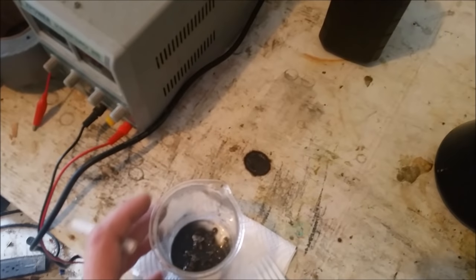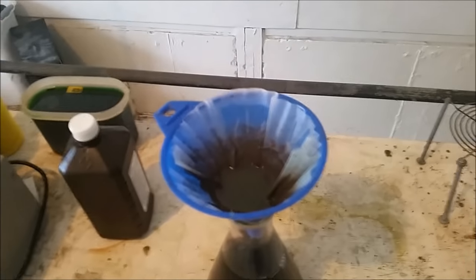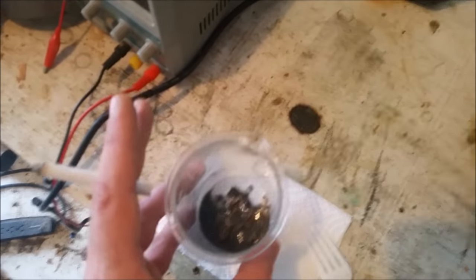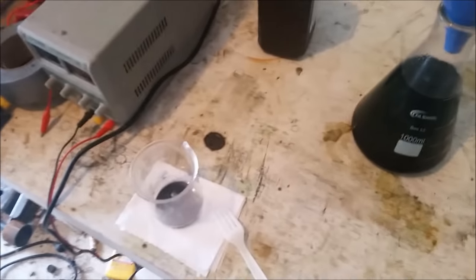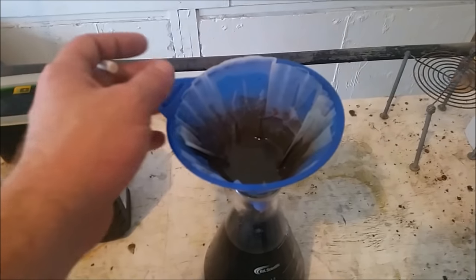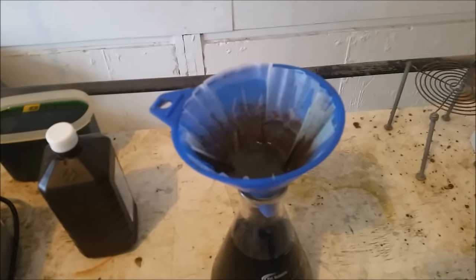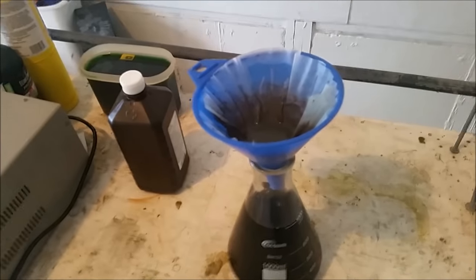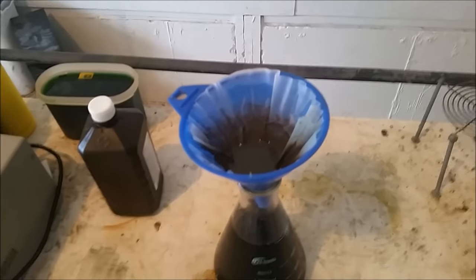There's a decent bit of mud still draining. Soon as that's done, we will go ahead and dry it out and torch it down. Hopefully get a bit of silver out of it. I see a bit of gold in there — little tiny flakes. I will process that out whenever I process the gold from the other batch. The grand majority of base metals should be removed, and if they're not, it's not hard to remove them. I will go ahead and torch the filter with the powder on it — the carbons will burn right off, turn into CO2. And if you do have any other base metals, the carbon will only help to reduce them back to metal form.